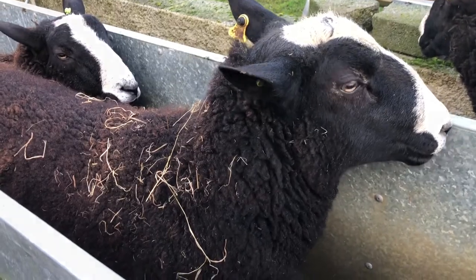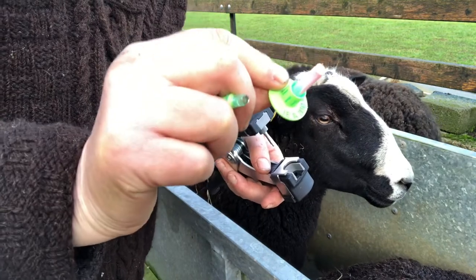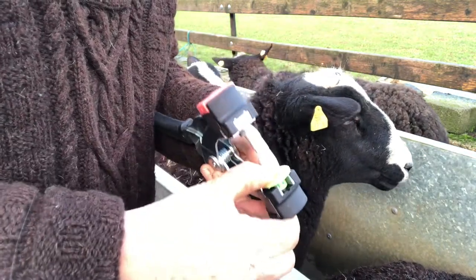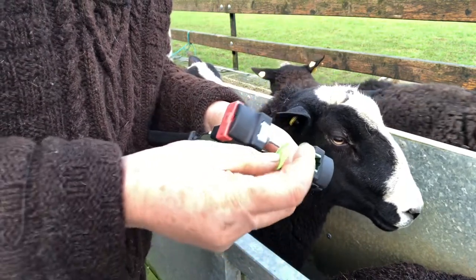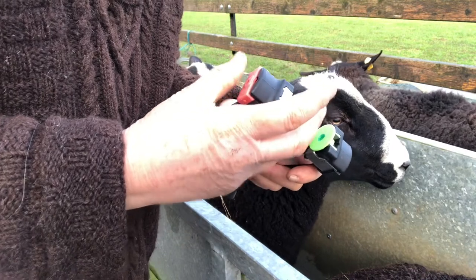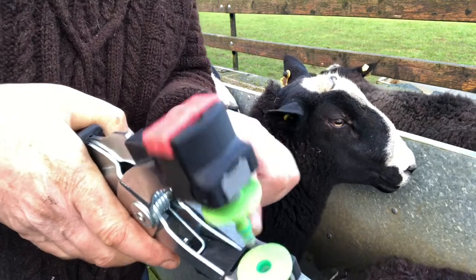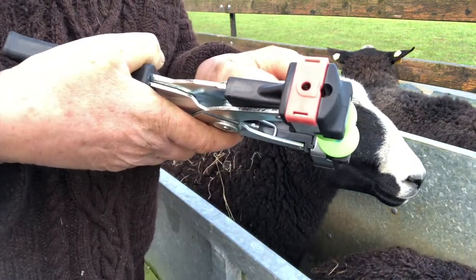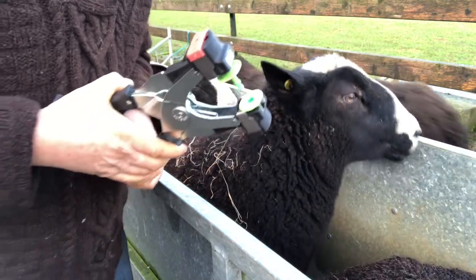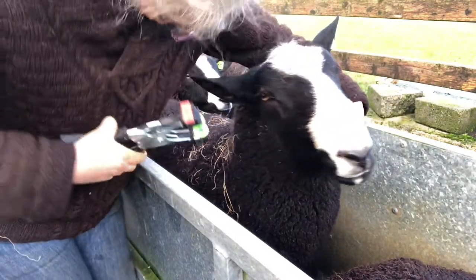I need to load it and it'll take two hands. This part here is the vial which will have the genetic material in it — it goes in the bottom. Then this part of the tag goes into the top and is secured. The vial is sealed, so I put this in the ear. This is going to be the fun part — I hope I can do this without too much trouble.